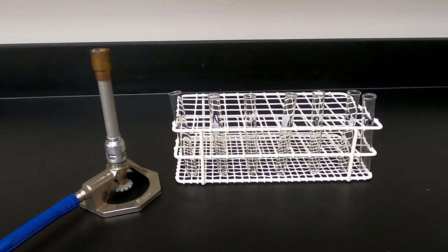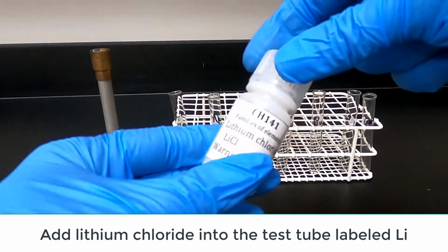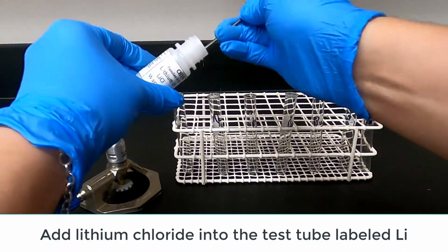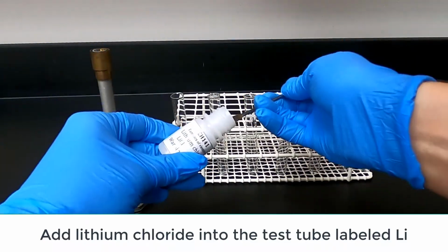Obtain 7 test tubes and a test tube rack. Using a marker, label the test tubes as lithium, sodium, potassium, calcium, barium, strontium, and unknown. Using a spatula, place a pea-sized amount of each salt into the corresponding test tube.